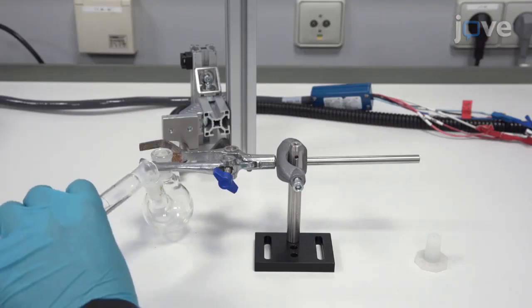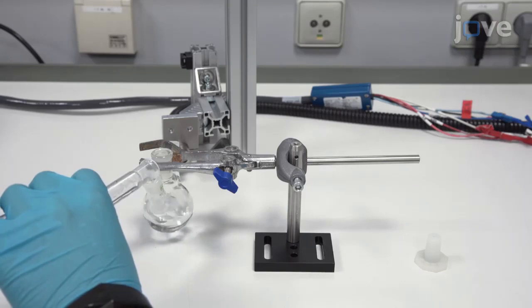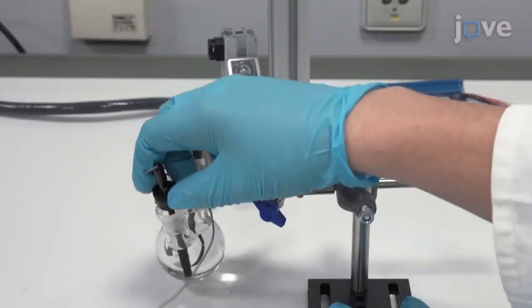Use a borosilicate glass cell with a quartz window as a photoelectrochemical cell and place the P-type indium phosphide electrode in the cell.